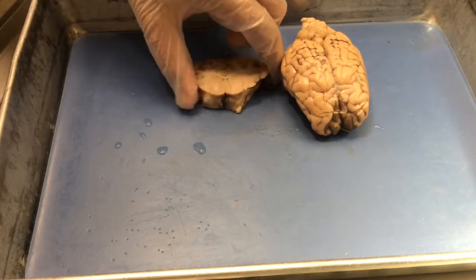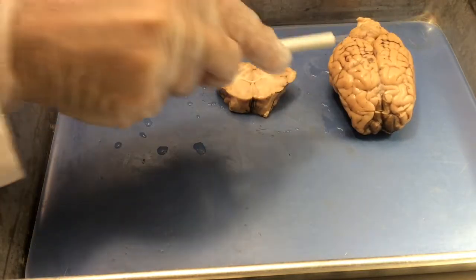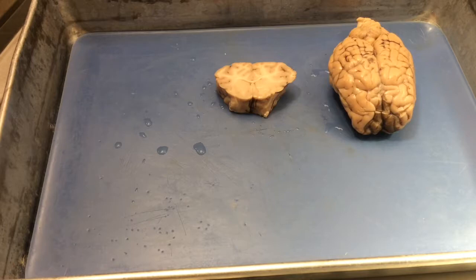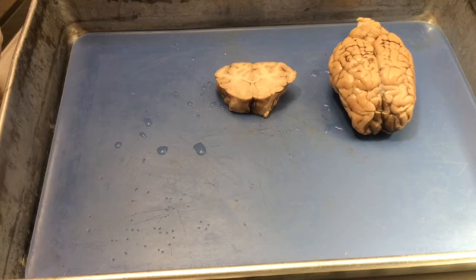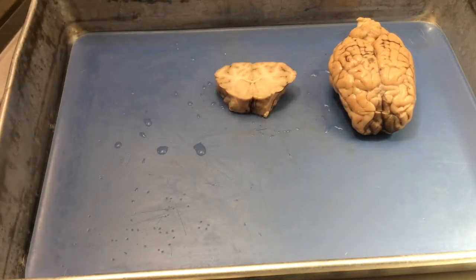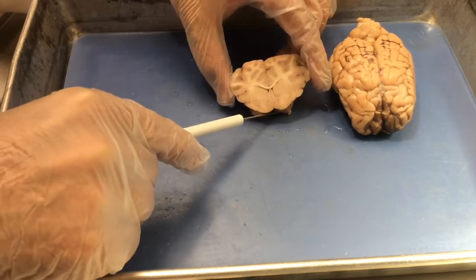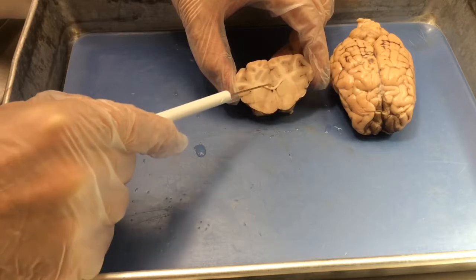Okay. So the first section we have is anterior forebrain. Again, the plane of section would be just through the front part of the parietal lobe. You can certainly make coronal sections more anterior than this. The most anterior sections will contain only cerebral cortex. As you move back, you'll see structures that are visible on this particular section for quite a long distance in the sheep brain.